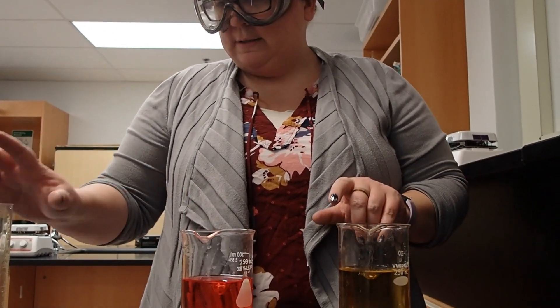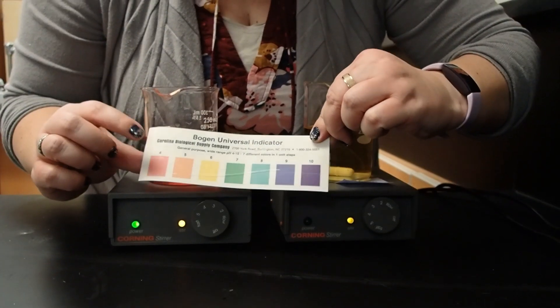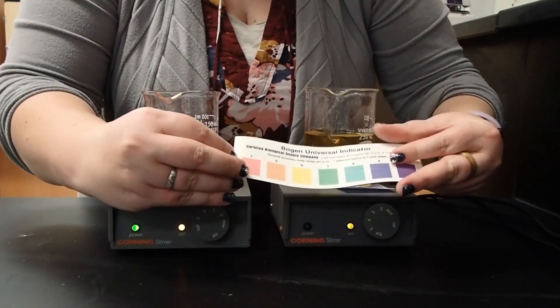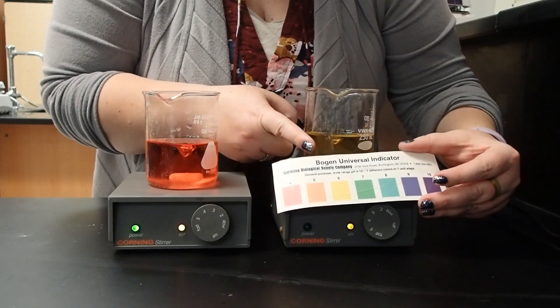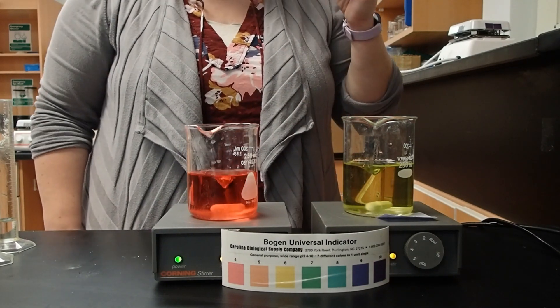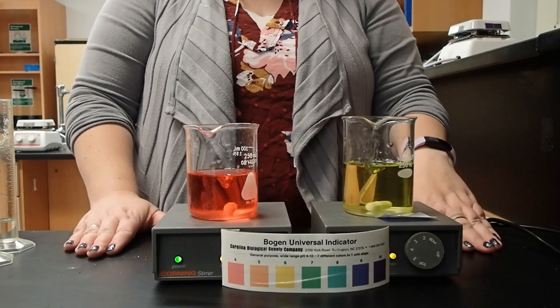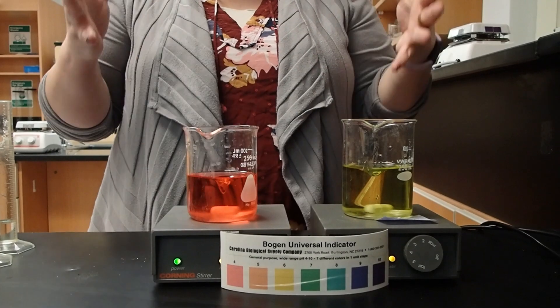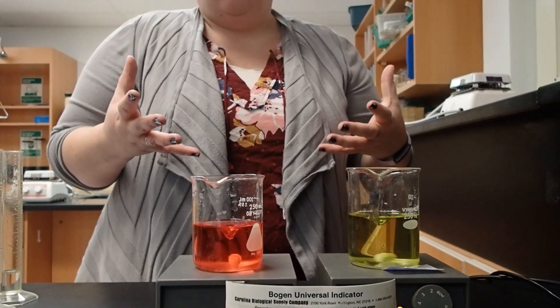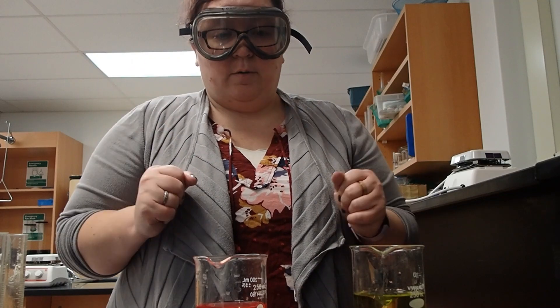Here we have our two solutions. I've added the same amount of acid to each, and now we can see our final pHs — we've gone quite acidic where we weren't buffered, whereas our buffered solution is still only slightly acidic around a pH of 6. Our buffered solution was able to absorb those excess hydrogen ions and resist that pH change. That's how our surface alkalinity is going to work: large bodies of water are often a little bit basic, especially if they have those carbonate ions to draw from, allowing our surface water to be buffered and absorb those excess ions from acidic rain and overall neutralize our solutions.